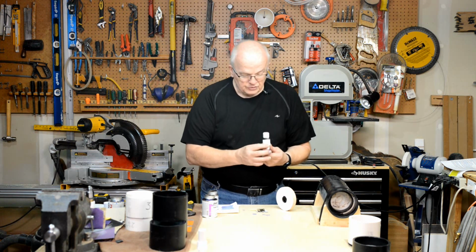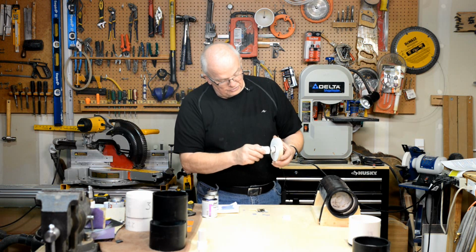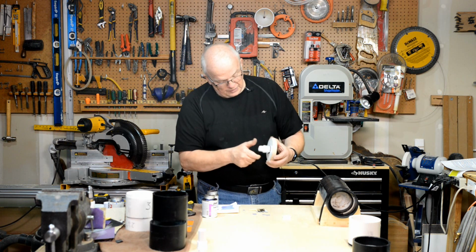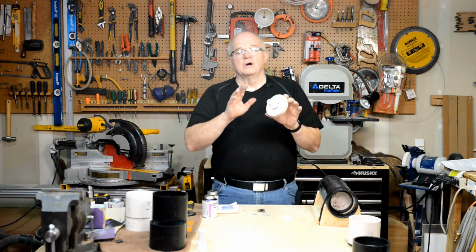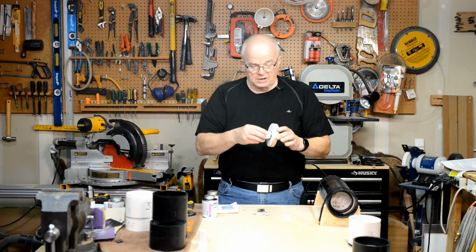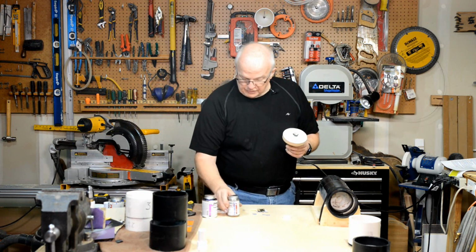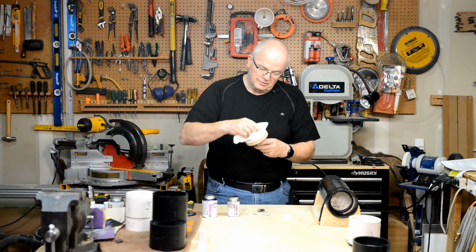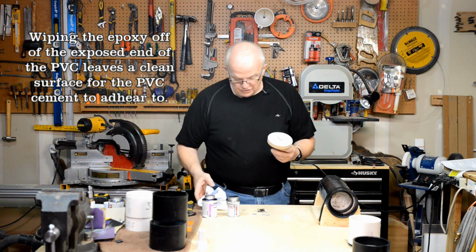Okay, so now that I've got epoxy around there and around this outside edge, I'll put this in there and I'll twist it a little bit as I push it down. Now notice you've got epoxy squeezing out all around here. Avoid the temptation of wiping it and trying to make it look clean and pretty. Leave it as it is. Then take a piece of paper towel and wipe a little bit of that epoxy off of that edge there, just so you don't make a mess.